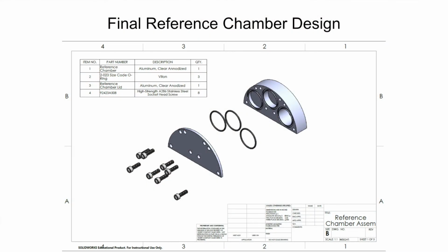Aside from cleaning and repairs, it does not need to be opened regularly, meaning screws and abraded particles were less of a concern as it will not be serviced in the glove box environment. The dimensions and numbers of the reference chambers were determined analytically as discussed above. The form of the reference chamber was to minimize the footprint of the assembly and to ensure it could be passed through the glove box porthole during assembly.